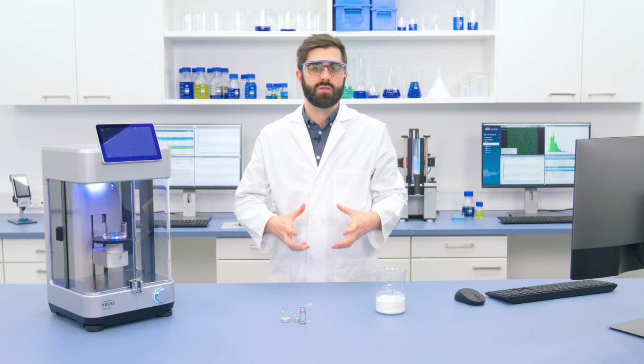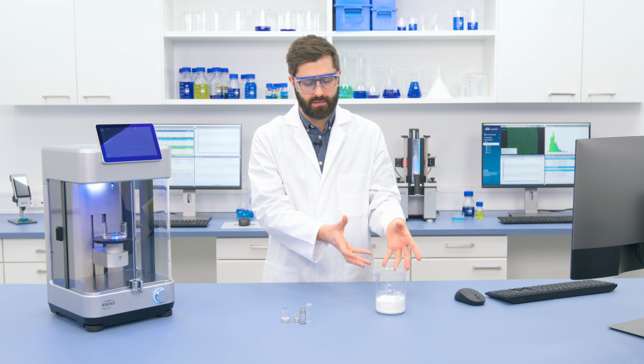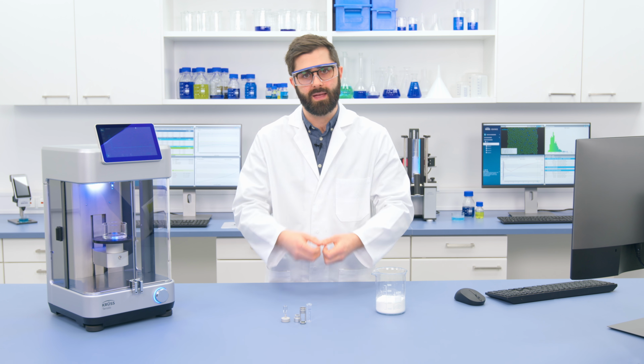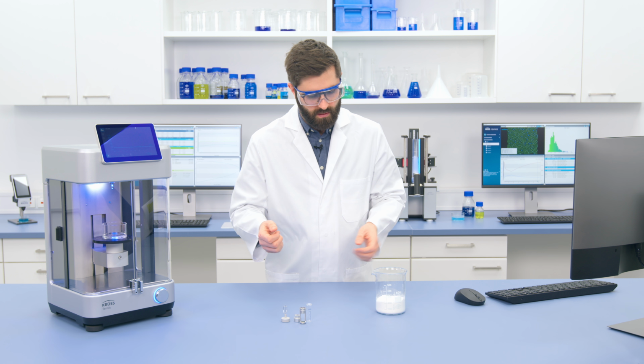The next thing we need to do is to prepare our solid material, so our crystalline cellulose. For that, we have a special sample preparation set called the Washburn set. And this allows us to pack some powder into a small holder without it falling down into our liquid completely. So first of all, I can take these over to our balance because we need to weigh out a certain amount of the cellulose into this cell.